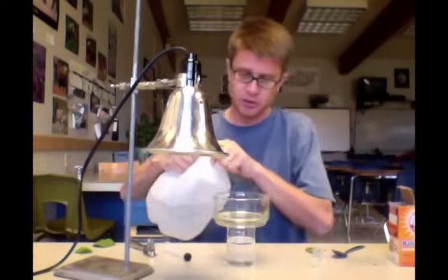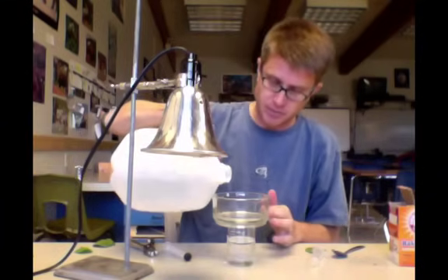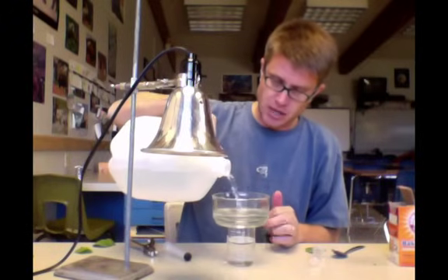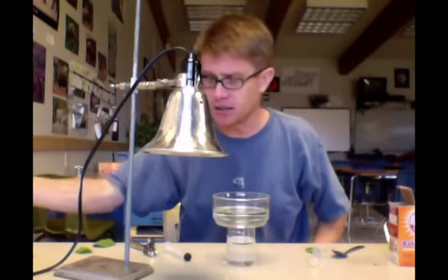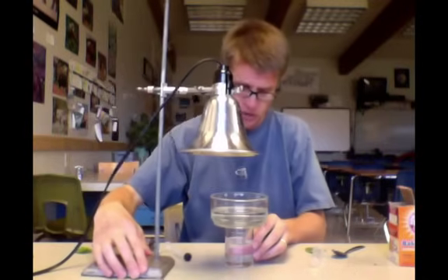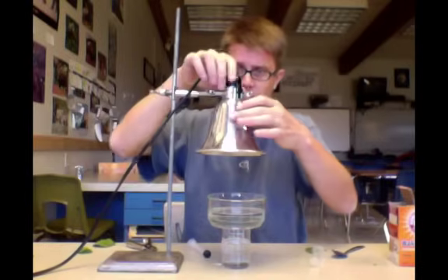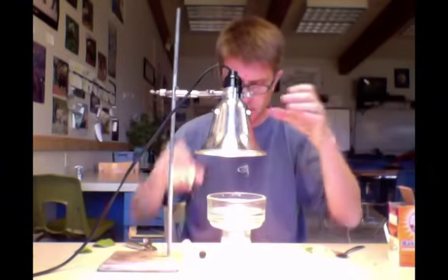I'm going to put this over the top and put a little bit of just regular water in there. What this will do on the top is it's going to act as a heat sink. It's going to absorb the heat of the light, so it's just the light that's actually making its way through. I'm going to start it like that.